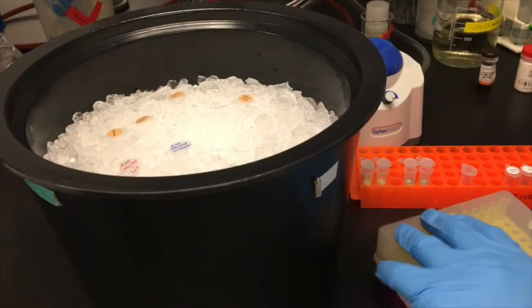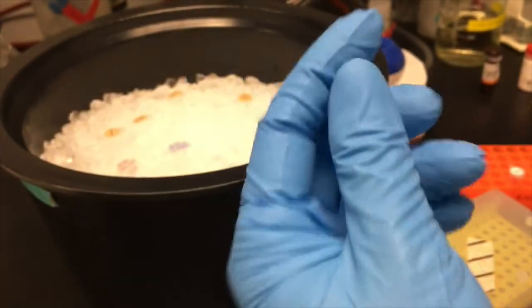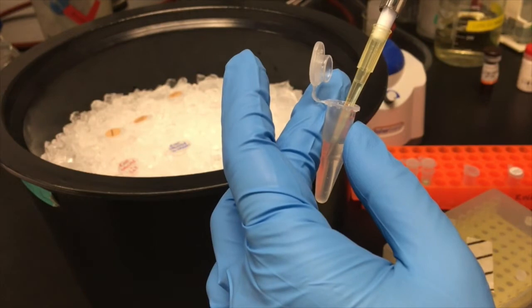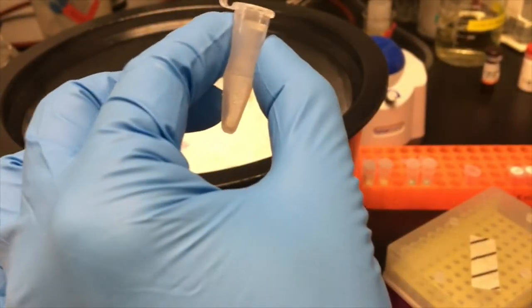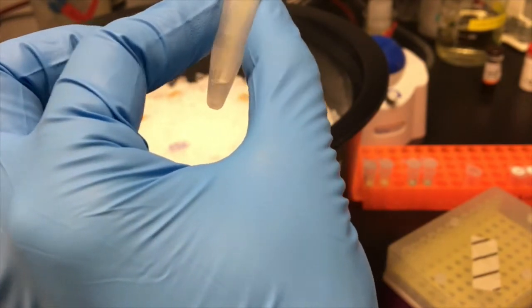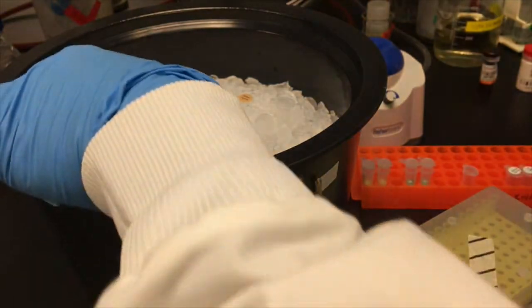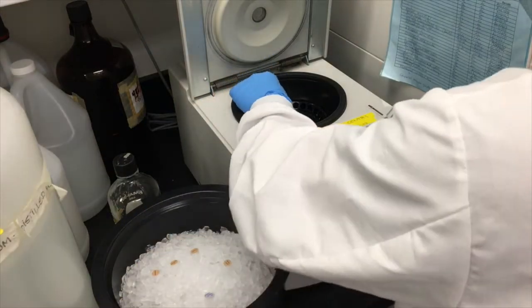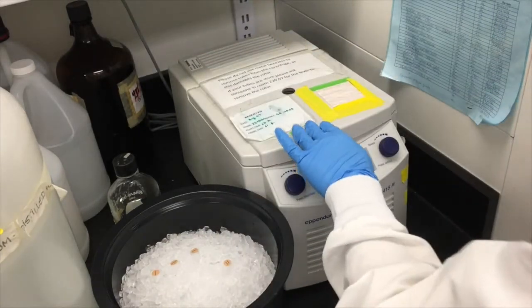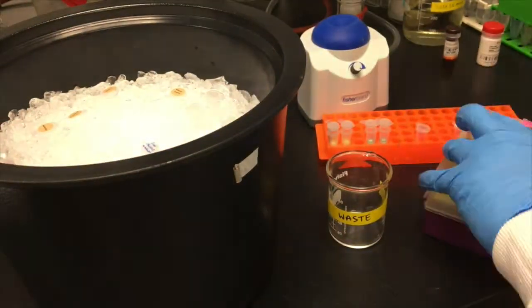The first thing that you are going to want to do is wash the cells to remove traces of the RNA later preservative. Do this by pipetting 200 microliters of TE buffer over the cell pellets and resuspending them by pipetting up and down. Pellet the cells again by spinning the balanced tubes on a mini centrifuge for 1 minute. Remove the supernatant by pipetting.